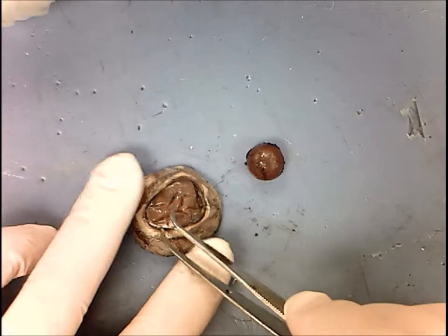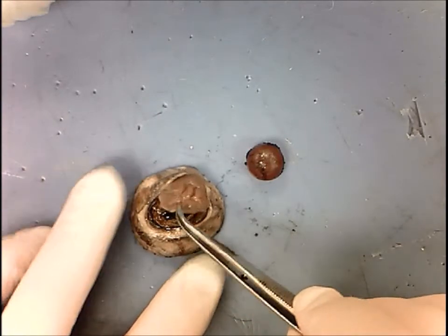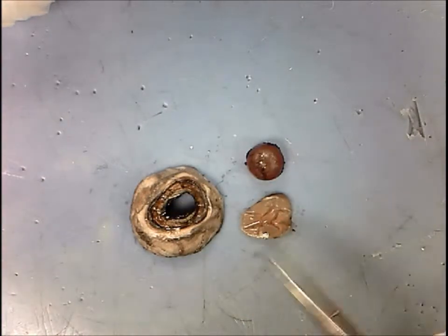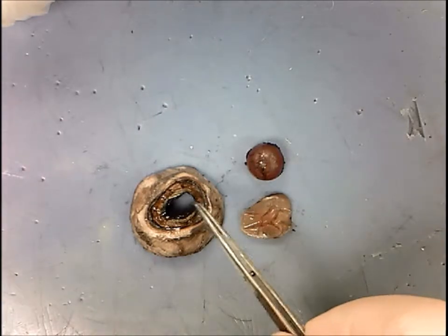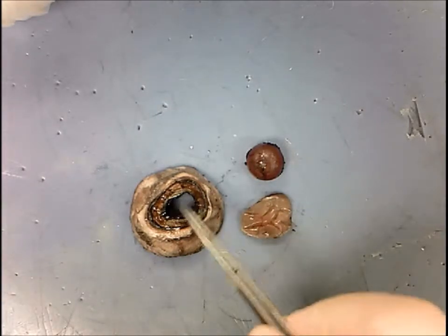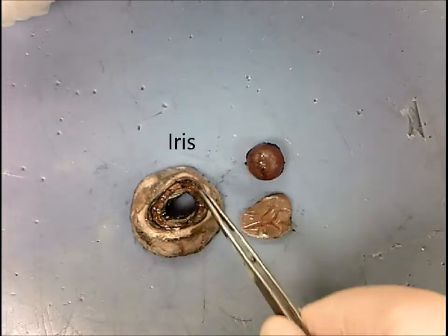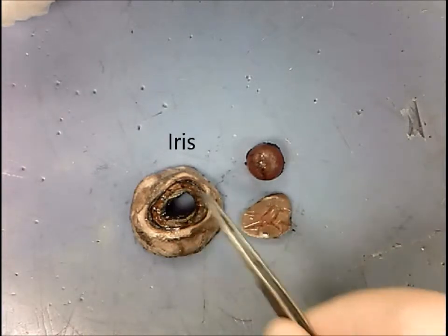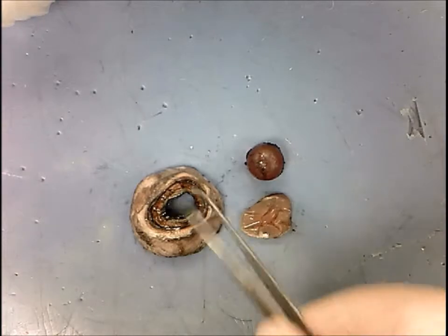If you remove the cornea, it is more visible to see the pupil and then the iris, which gives the eye its color — the colored part of the eye.